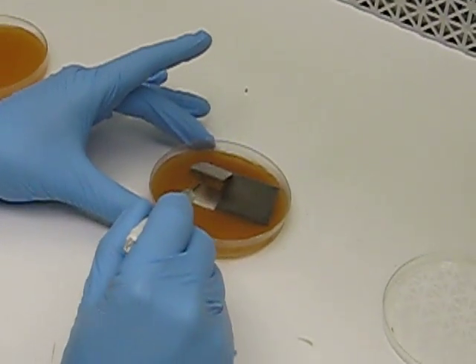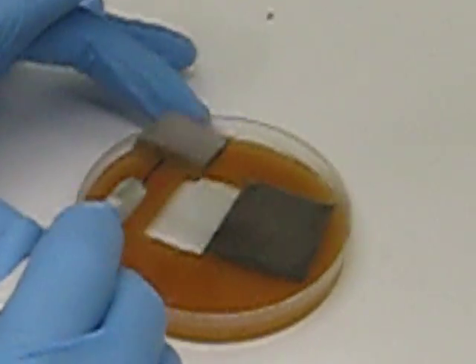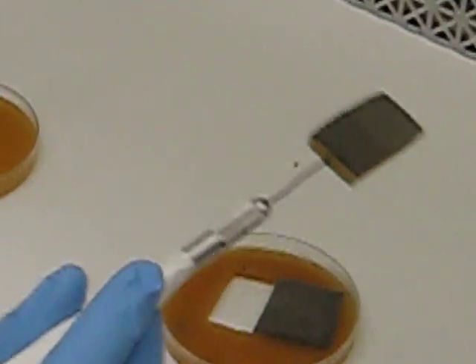I like to pick an end up and then pierce the agar. It's important that you don't poke through the agar and touch the biomass of the organism.